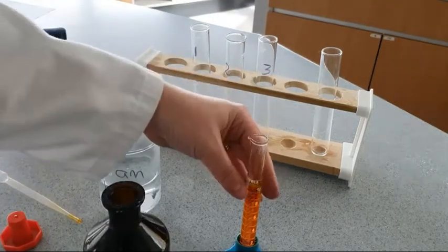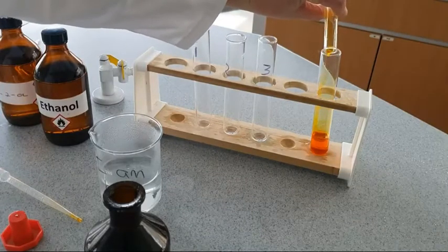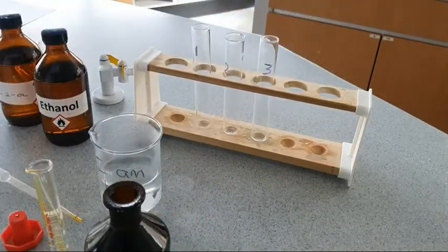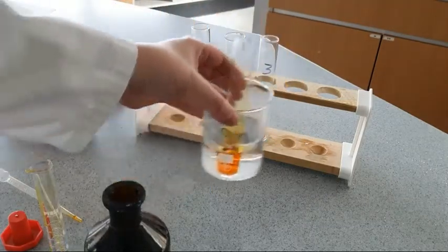So we're just going to place some acidified potassium dichromate into a test tube, and one of the conditions to cause this oxidation is that it needs to be warmed, and so we're going to place the acidified potassium dichromate in some hot water.